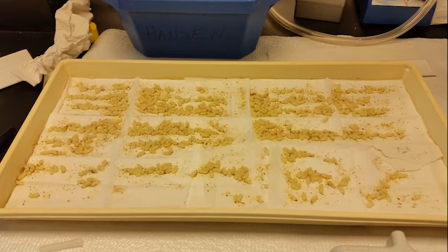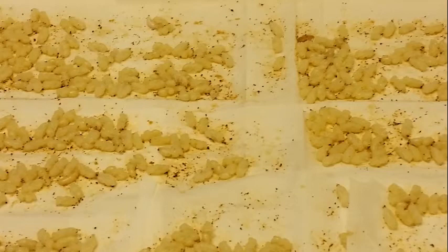One thing that you'll see on this, so this is a tray that has had those larvae start to pupate. One of the things that you can see here is lots of little dots of this meconium, which is the last defecation they do right before going into a pupal stage. Many of you might know meconium if you've ever had a baby. It's that first feces, that first defecation that babies do. It's really dark, like black in color, and it's different from their future defecations.